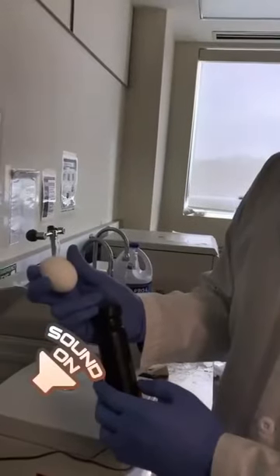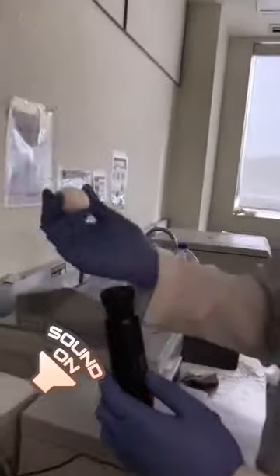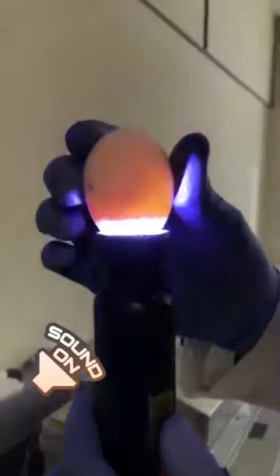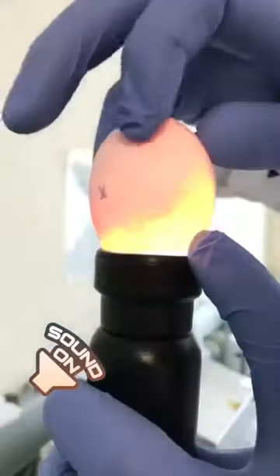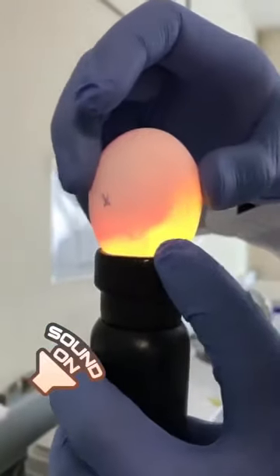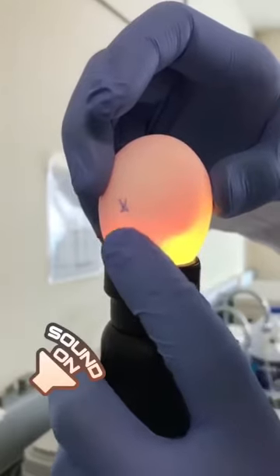To check how the eggs are doing, we just shine the flashlight under the egg. And you can see here — this is the embryo, and the blood is being supplied by these blood vessels right here.